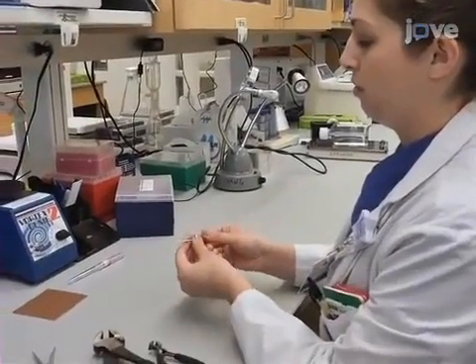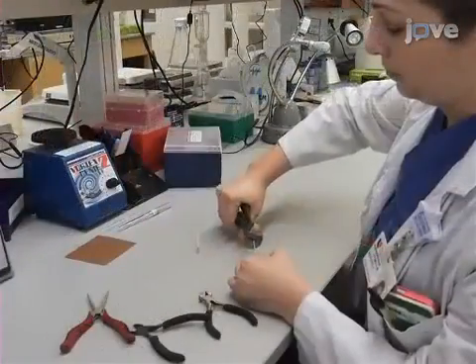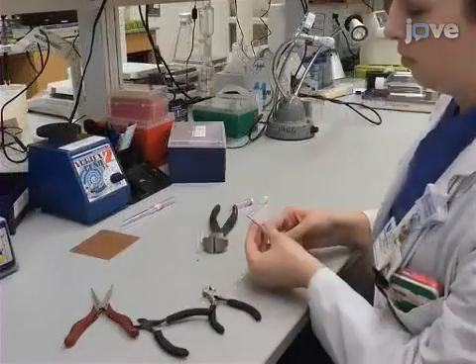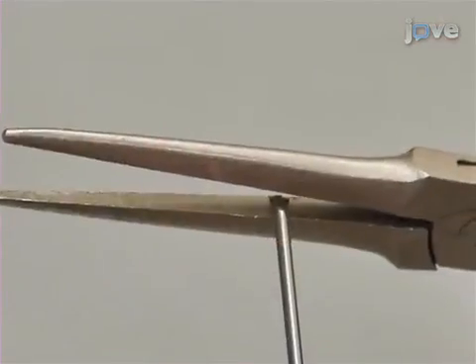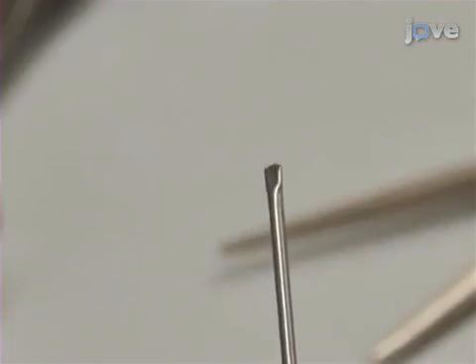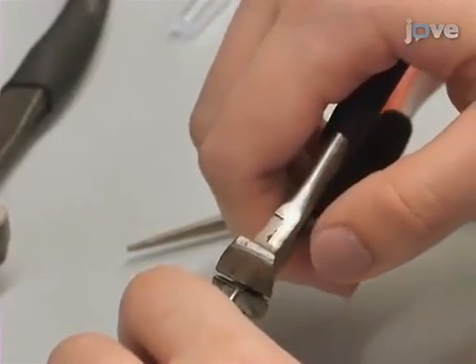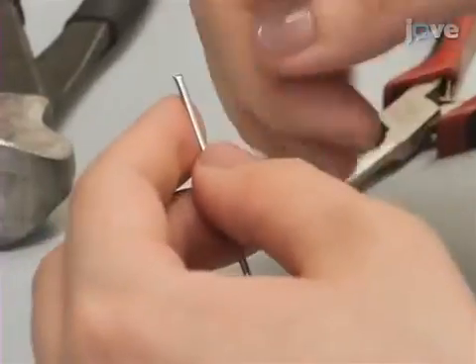To prepare the tracheal intubation cannula, first use cutting pliers to remove the needle end of a 2-inch 14-gauge angiocatheter needle. Pinch the lumen of the needle closed with needle-nosed pliers and then use the cutting pliers to remove the pinched section down to the edge of the open lumen portion.